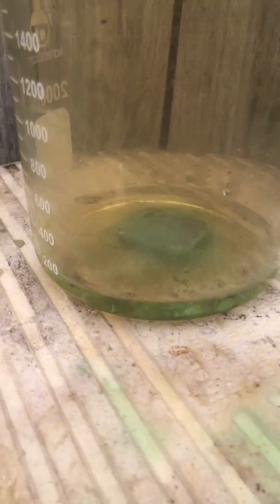Here is the little bar I made from my last video that was not pure silver, so we're going to go ahead and refine that in nitric right now. We're also going to put in that little silver nugget that we made as well.